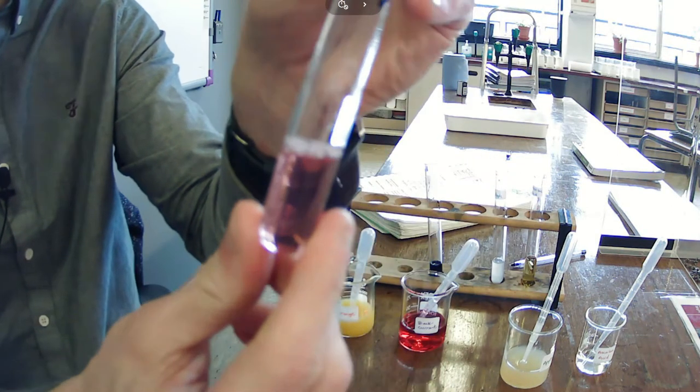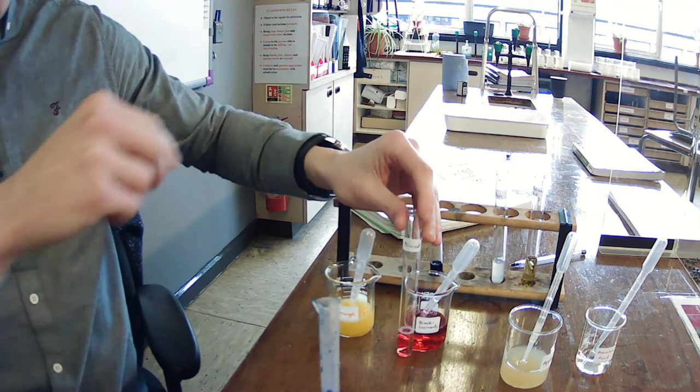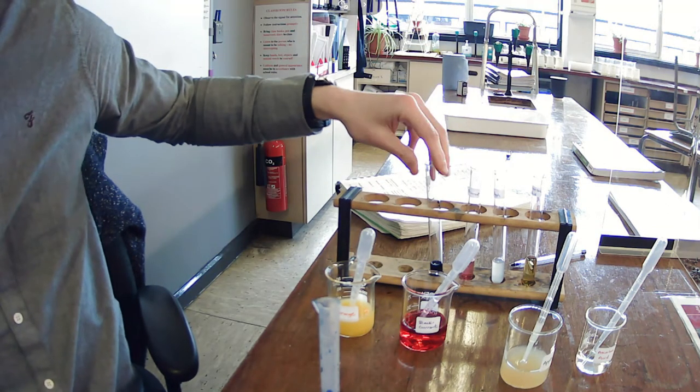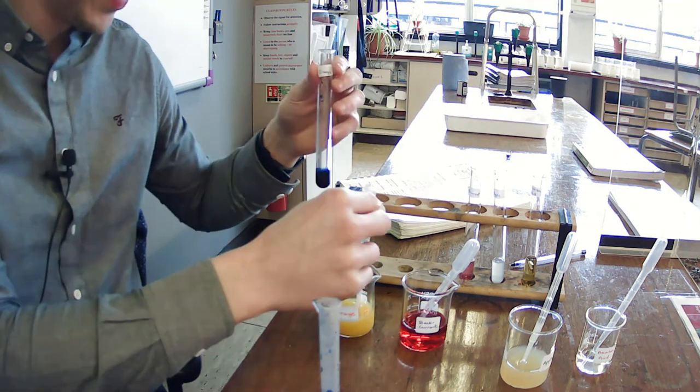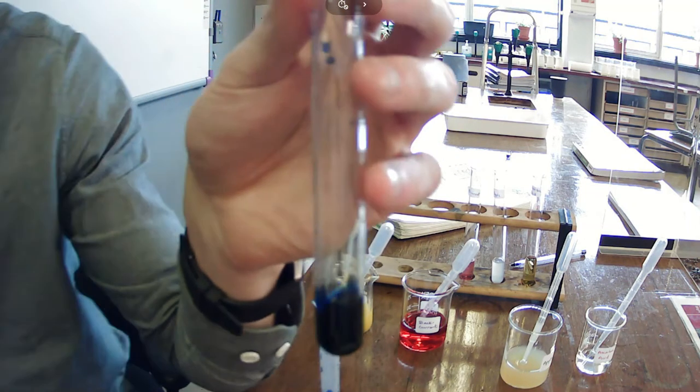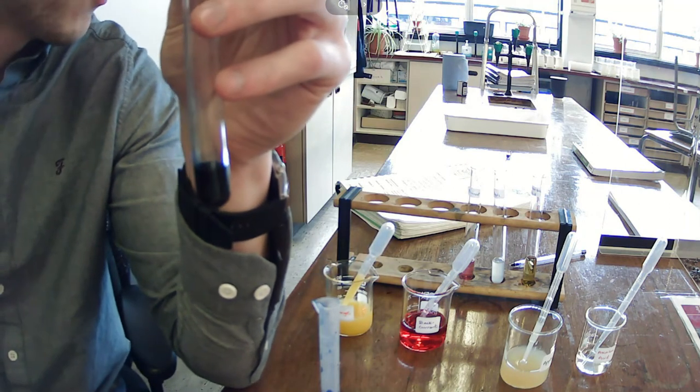Okay, so they're the same color, blackcurrant. So that means we have only one more. Okay, and a lot of people actually associate orange juice with vitamin C, so will oranges have as much vitamin C in it as blackcurrant juice, which had 30 drops?